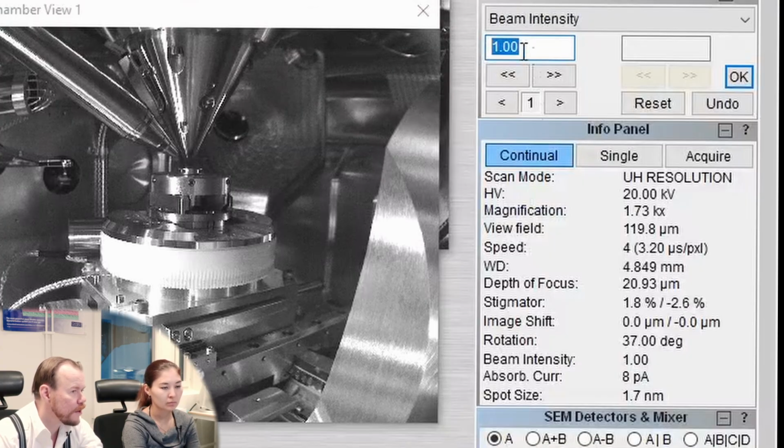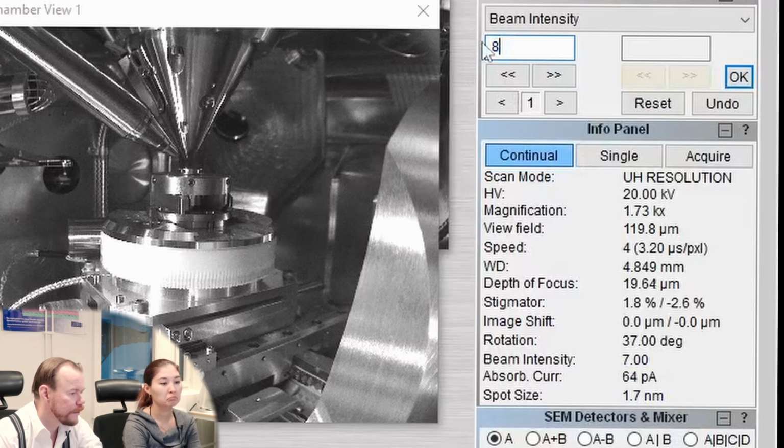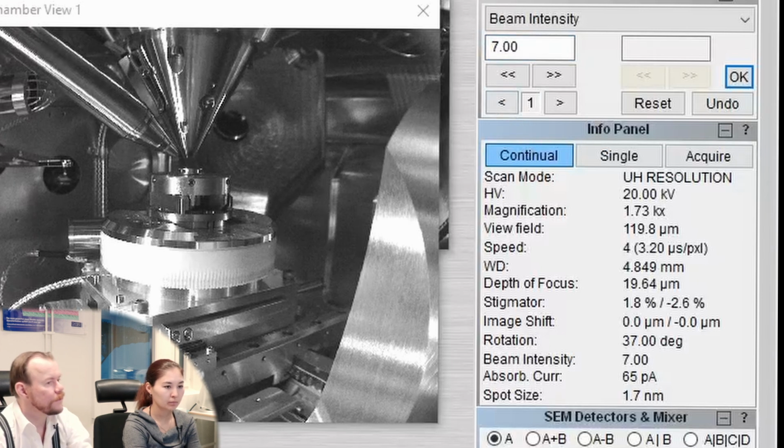So we can see how much we have to pay if we go to 5. You see, it's still 1.7. Okay. And if I go to 7, it's still 1.7. 8. Now it starts to go up. I see. So you can perhaps stay on 7.